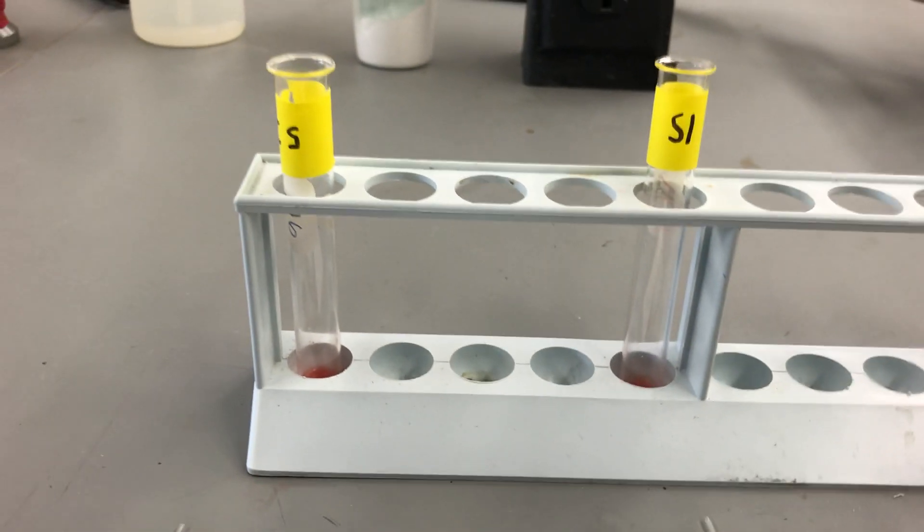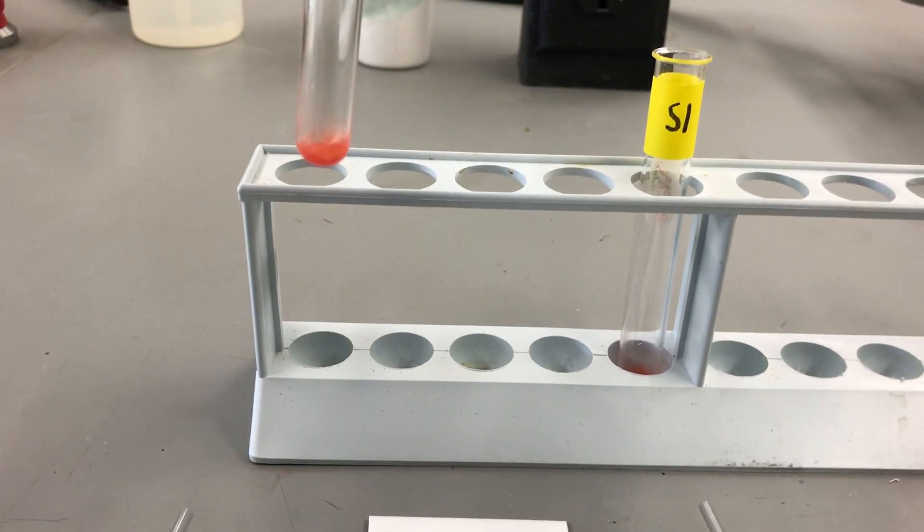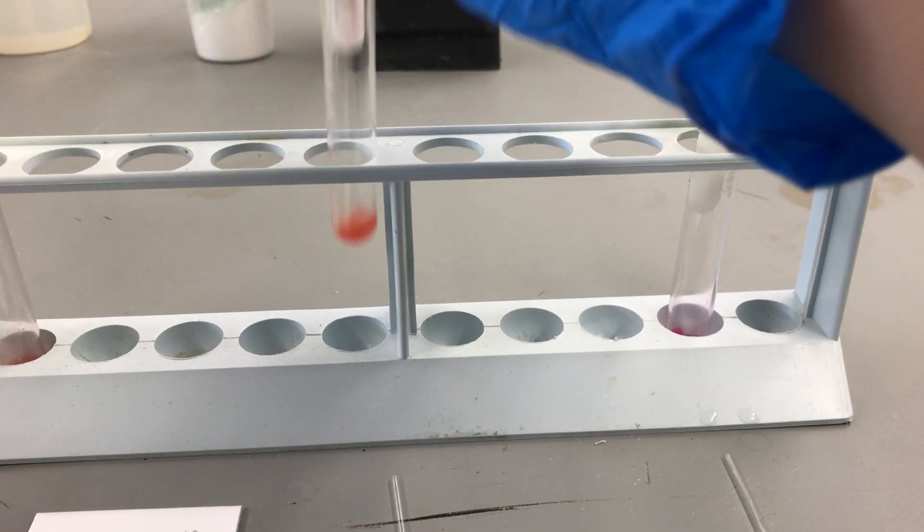Alright ladies and gents, our 15 minutes are up and it looks like we got some pretty good lipstick extraction from our napkin pieces.